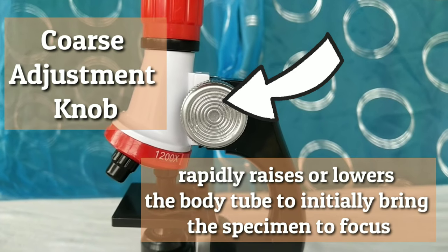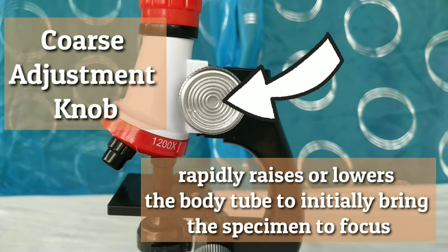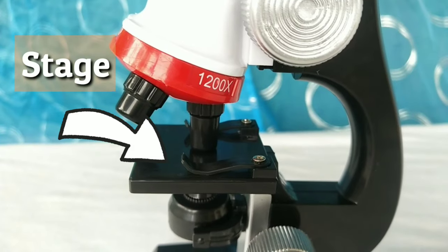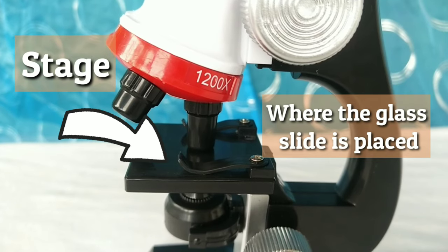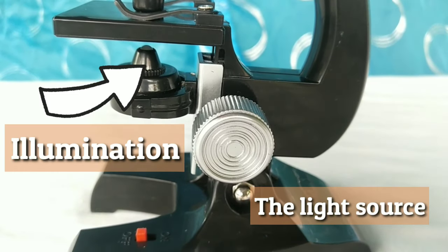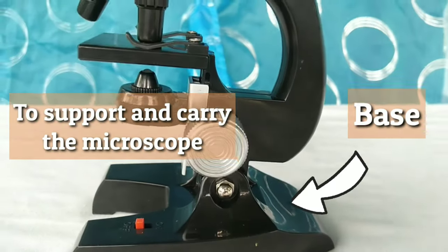and 1,200 times. Coarse adjustment knob rapidly raises or lowers the body tube to initially bring the specimen to focus. Stage — where the glass slide is placed. Illumination — the light source. Arm and base — to support and carry the microscope.